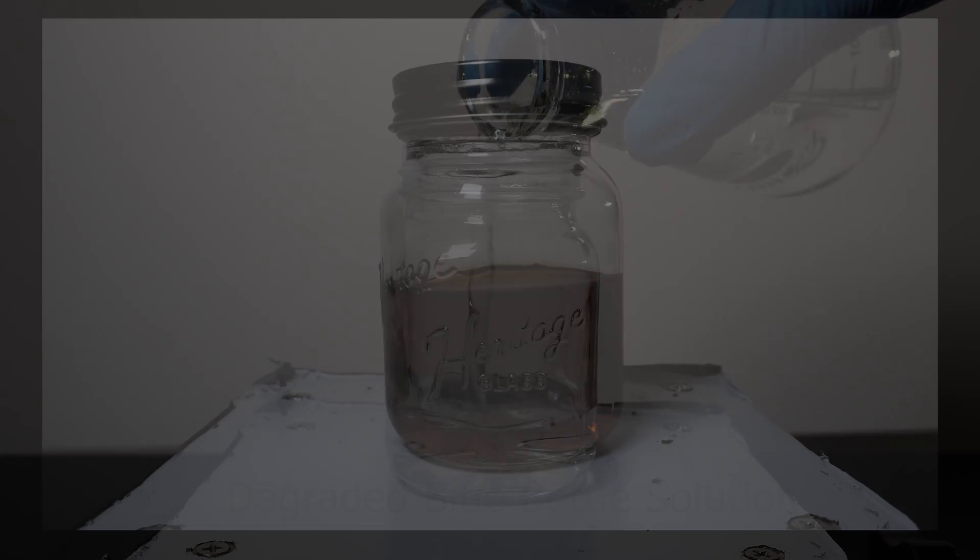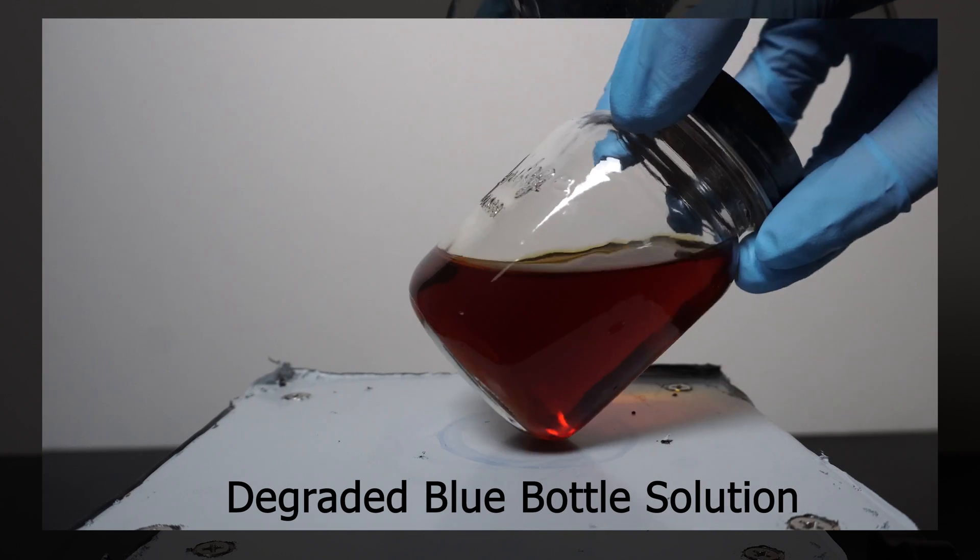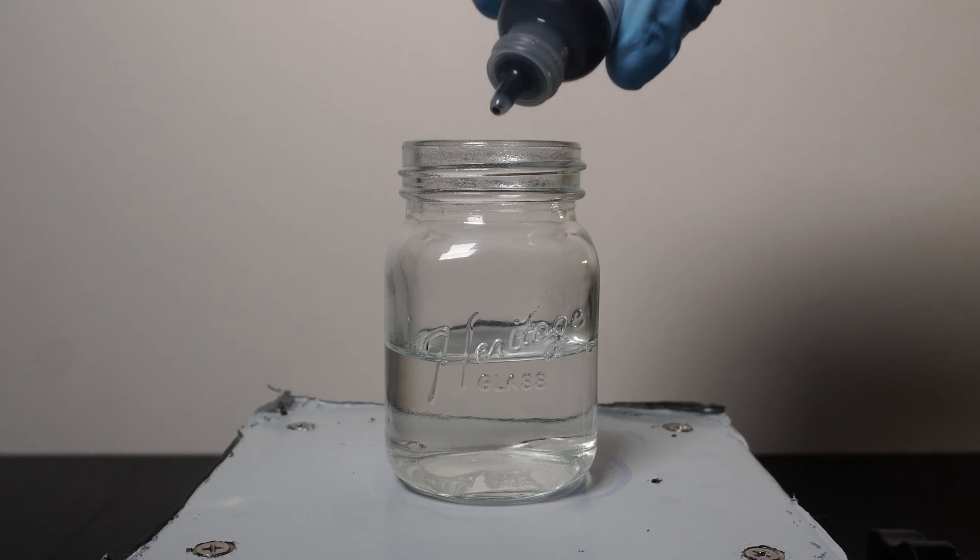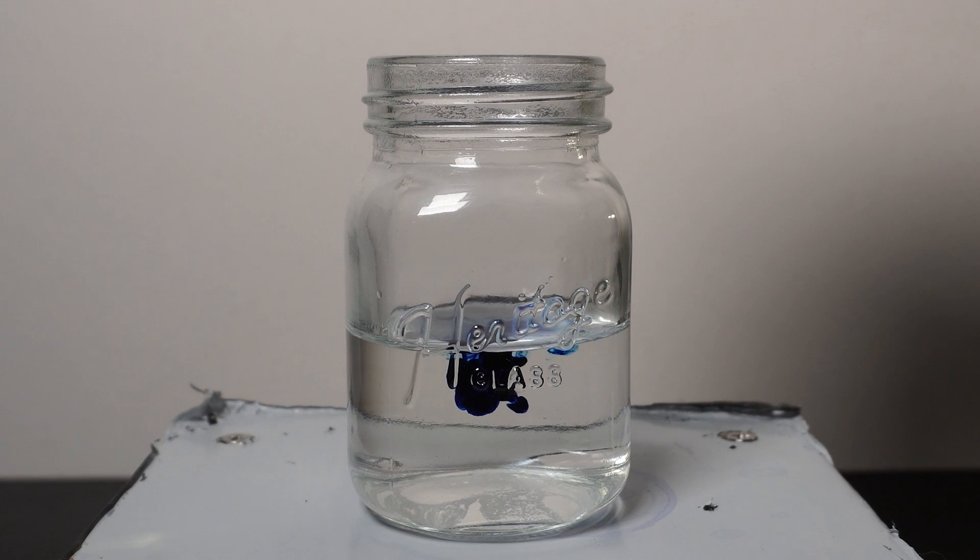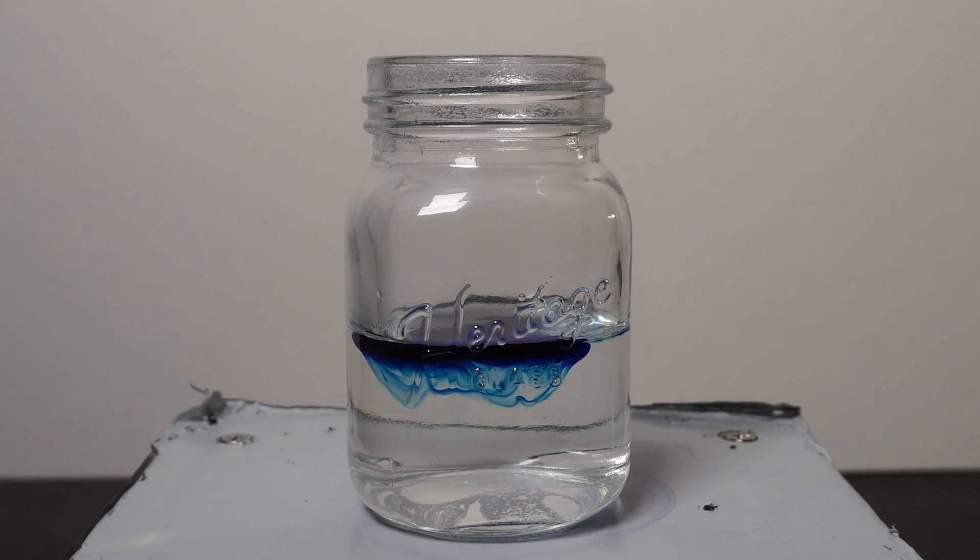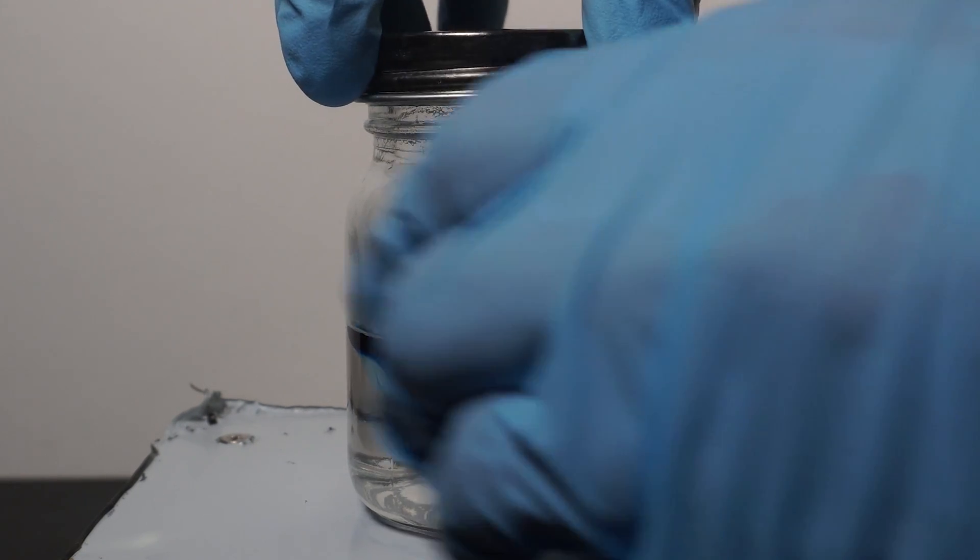Eventually, the dextrose does degrade, though that usually takes about 4 hours. Finally we add in 2 drops of methylene blue, and we can see that it initially kind of just floats on top. Though as it does spread out, there is actually something starting to happen here and the methylene blue is slowly being reduced to its colorless form.